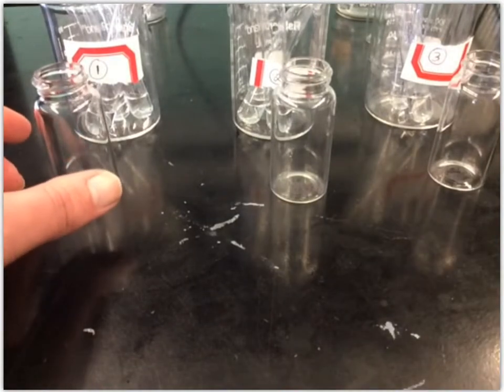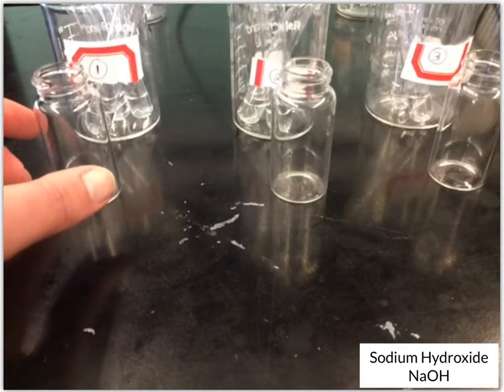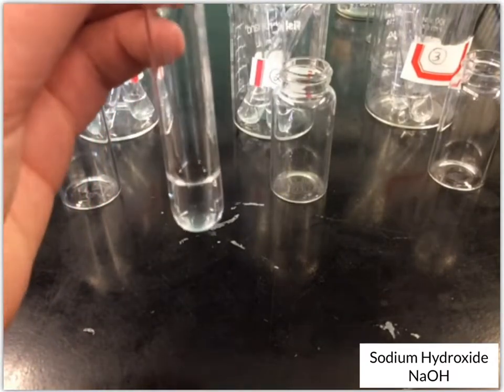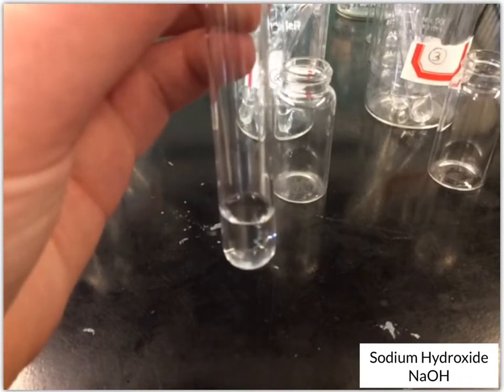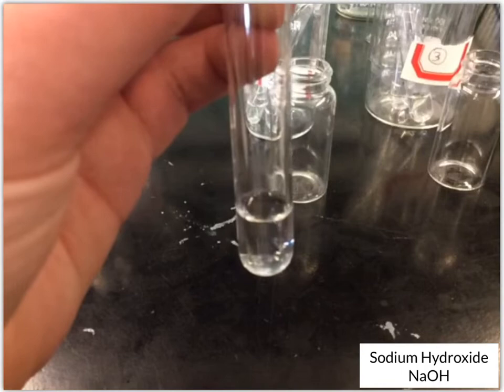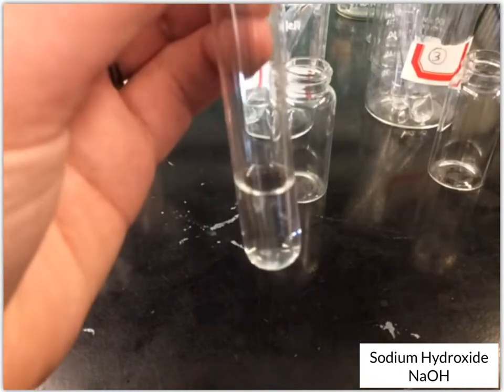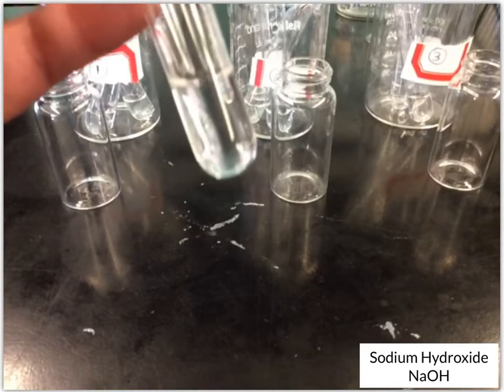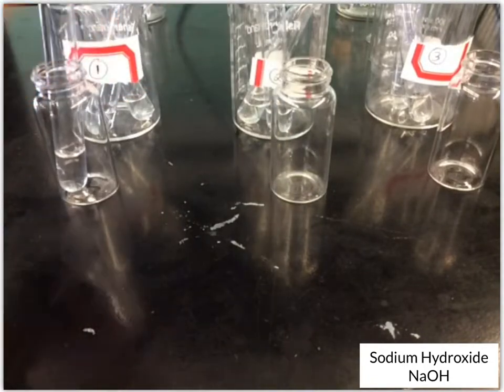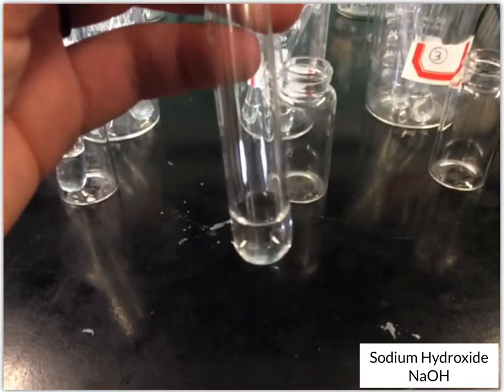Okay, next test, we'll run the sodium hydroxide. So we'll see what each does with sodium hydroxide. Unknown number 1 with sodium hydroxide. And it looks like nothing changed with that one. We have unknown number 2 with sodium hydroxide.